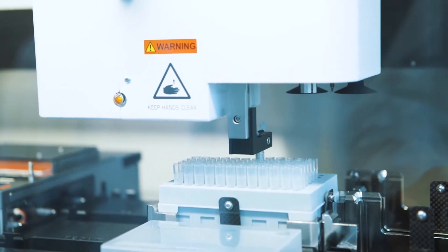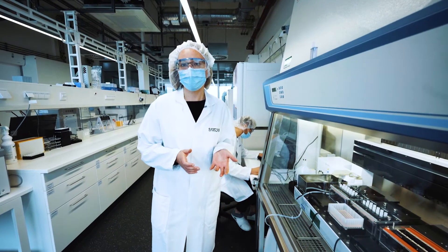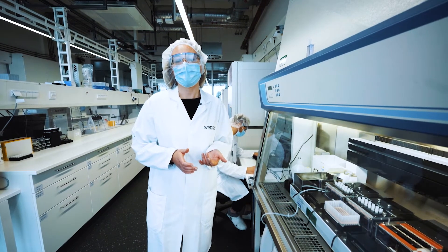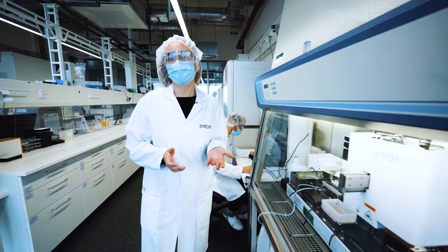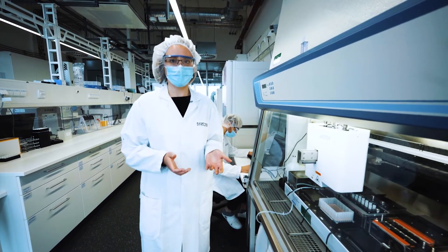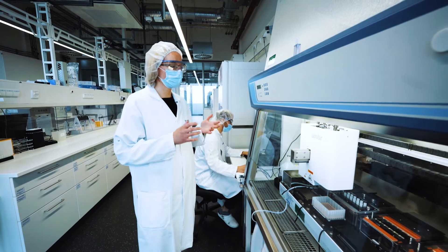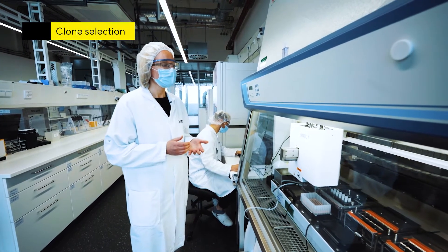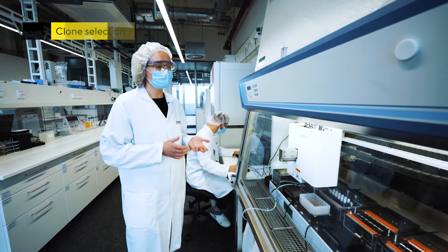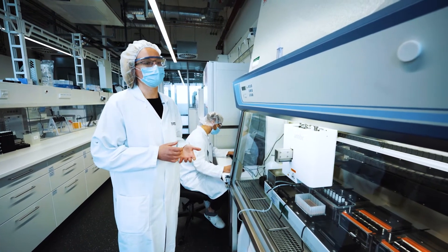Additionally, we have a cooperation with our bio-outsourcing site in Glasgow, which can offer an expanded portfolio for analytics. Together with the fed-batch data and the analytical data, these are discussed with the customers and the top four clones are chosen based on this data.